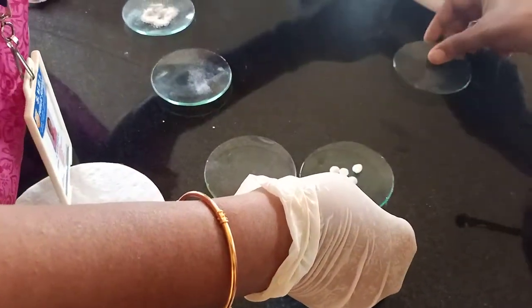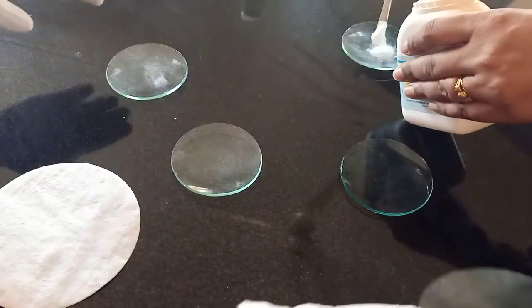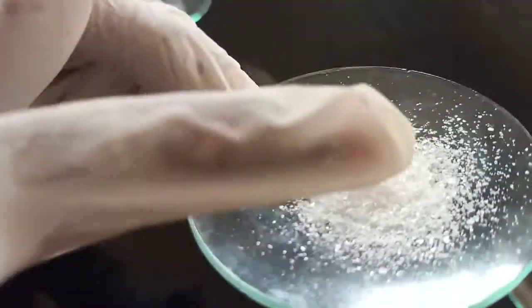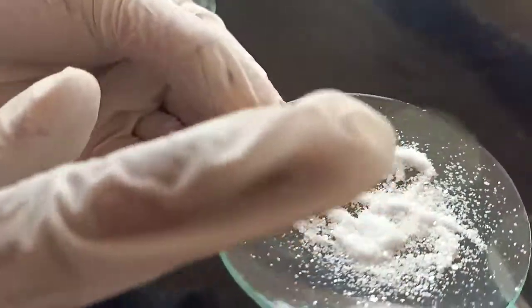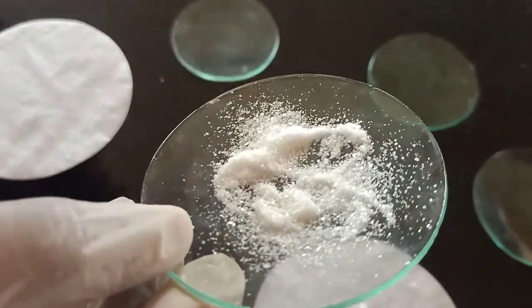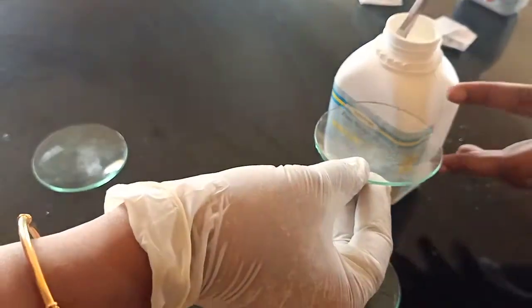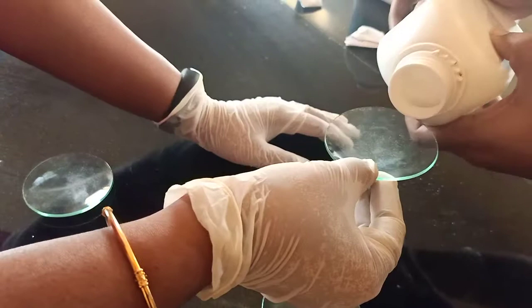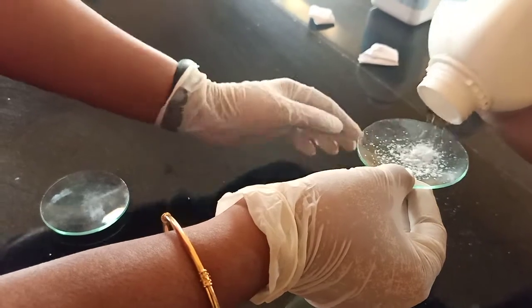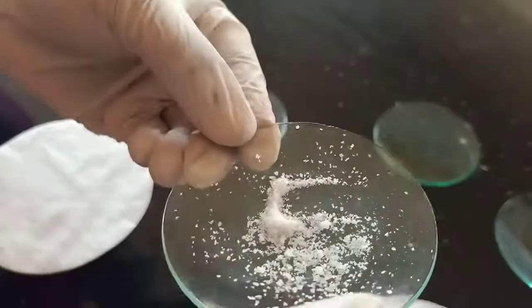Next, we will see barium chloride. See barium chloride — like glass if you break, that is how it will look. Same like that it is. This is barium chloride. Chloride salts actually will have this glassy texture. So this is barium chloride. The next salt we are going to see is zinc sulfate. See — this texture is also like that. This is zinc sulfate.